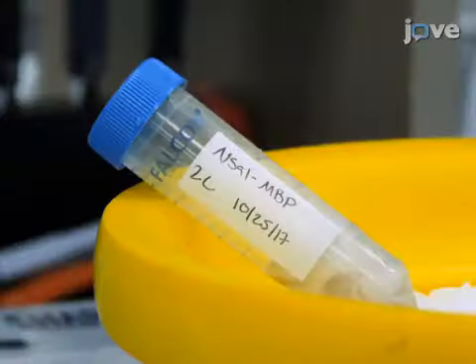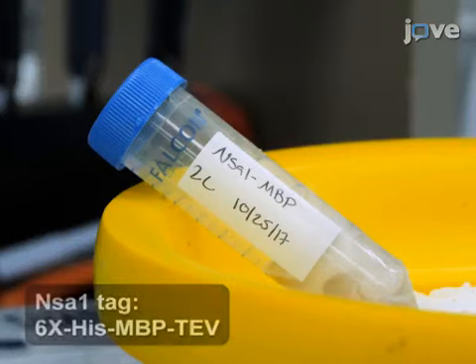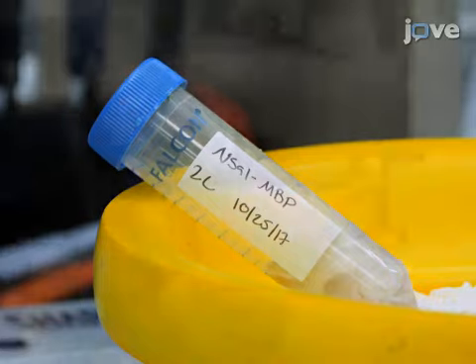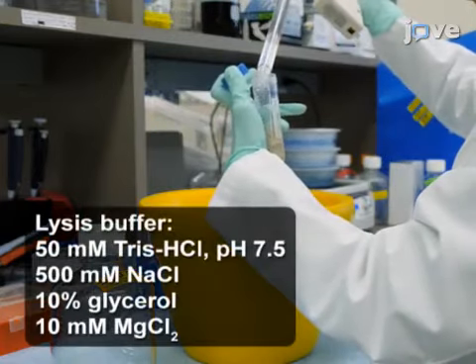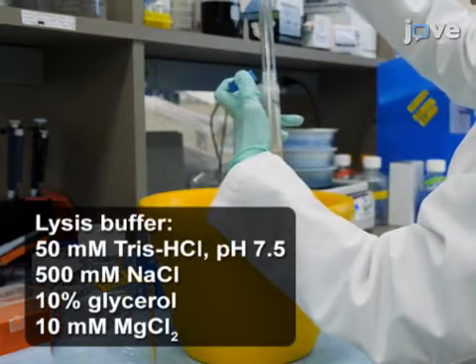To begin the procedure, transform an Nsa1 expression plasmid into a suitable E. coli expression strain. Culture the cells, induce Nsa1 expression, and harvest the cells. Resuspend the cells in 25 milliliters of lysis buffer, pre-chilled to 4 degrees Celsius and containing 1 EDTA-free protease inhibitor tablet.